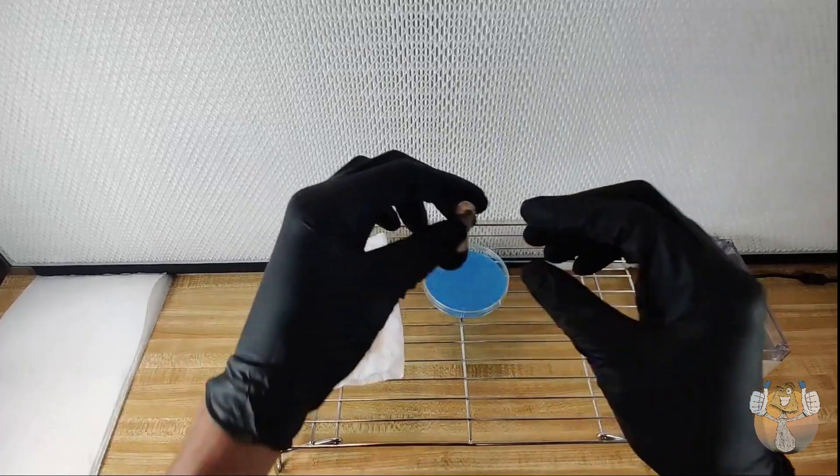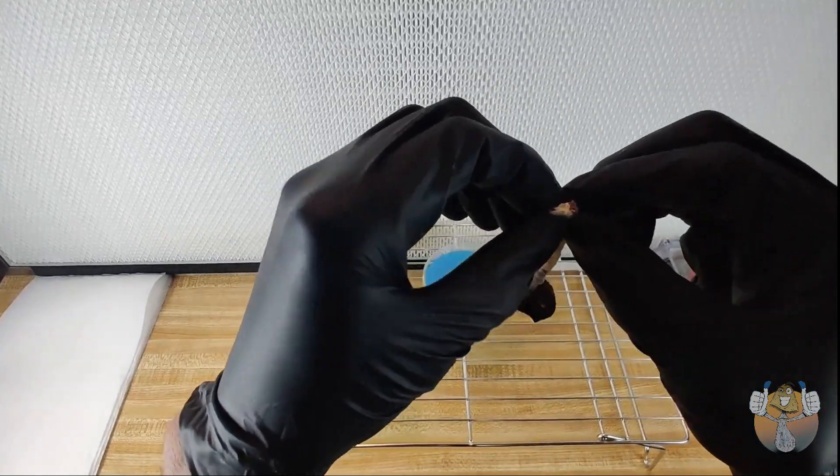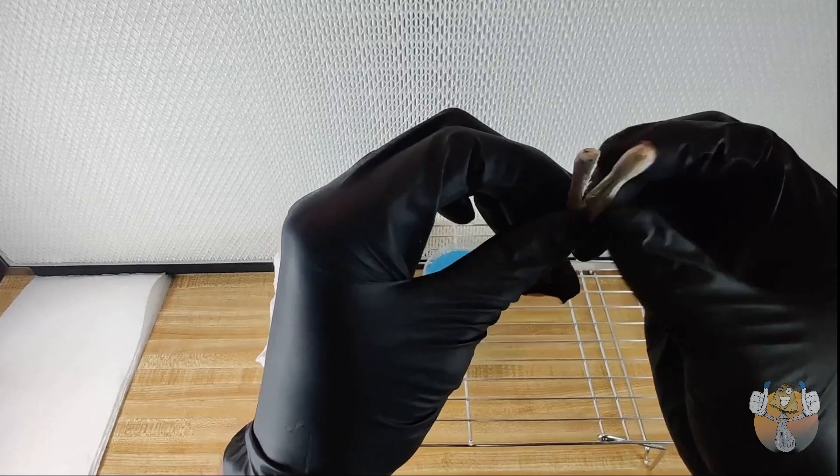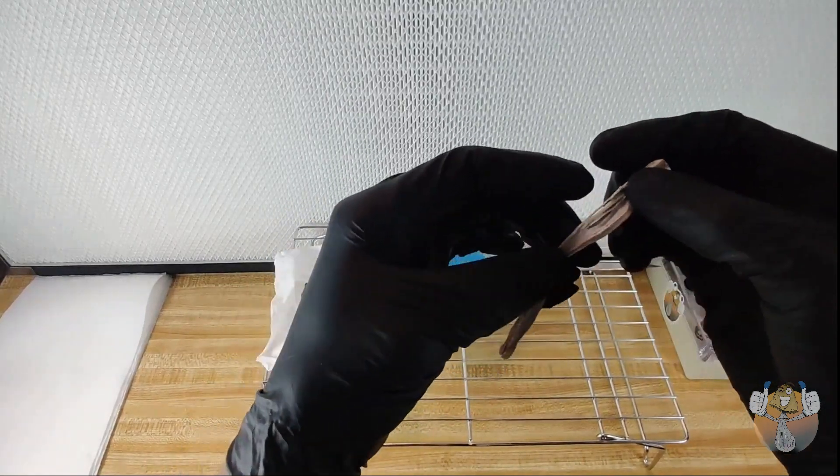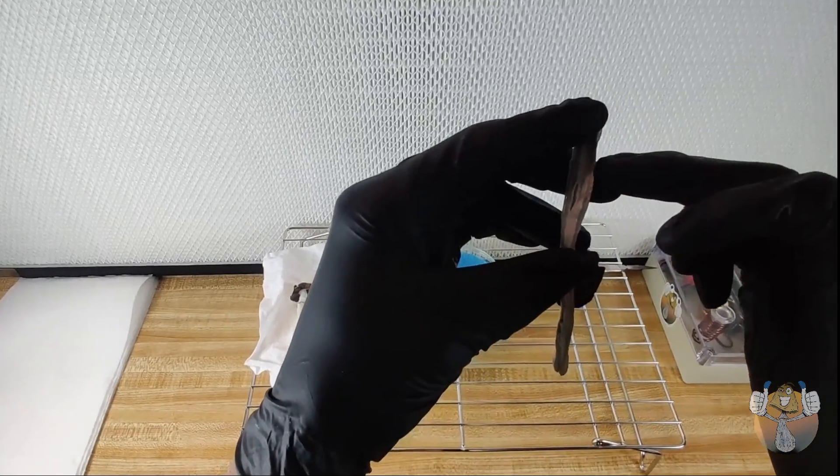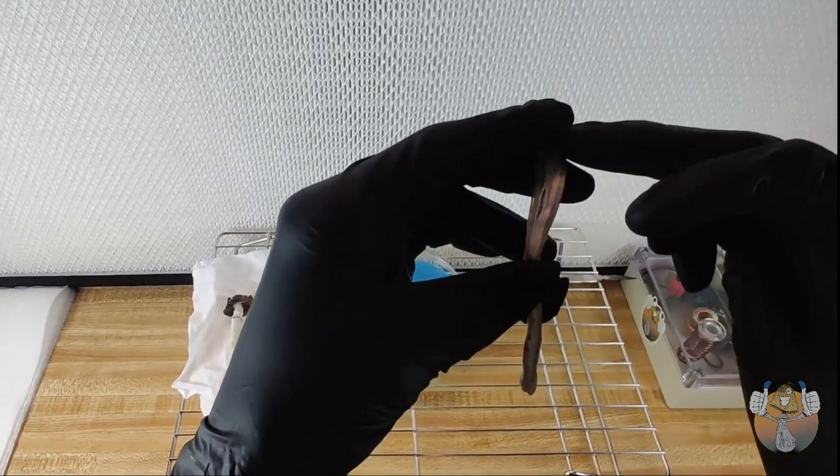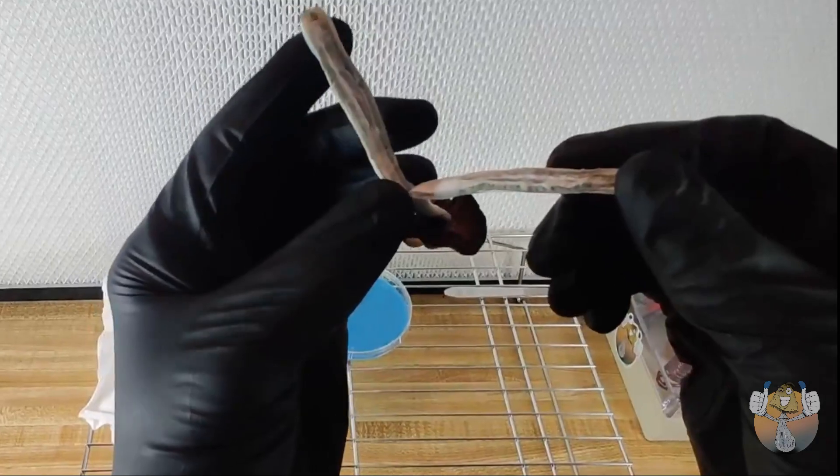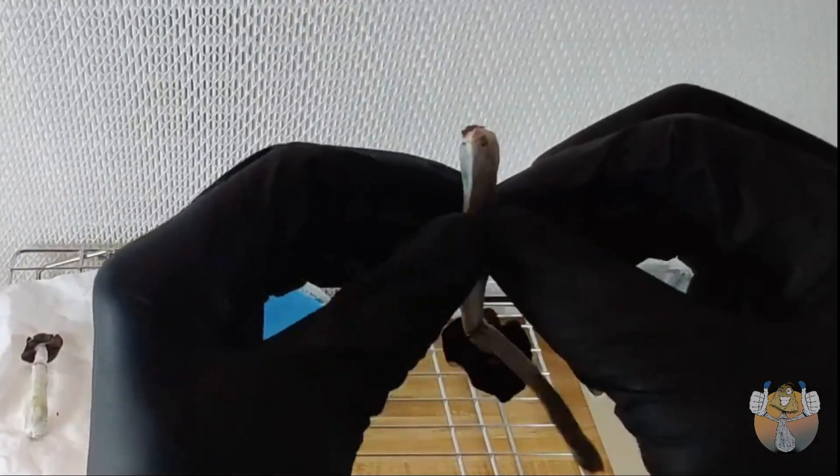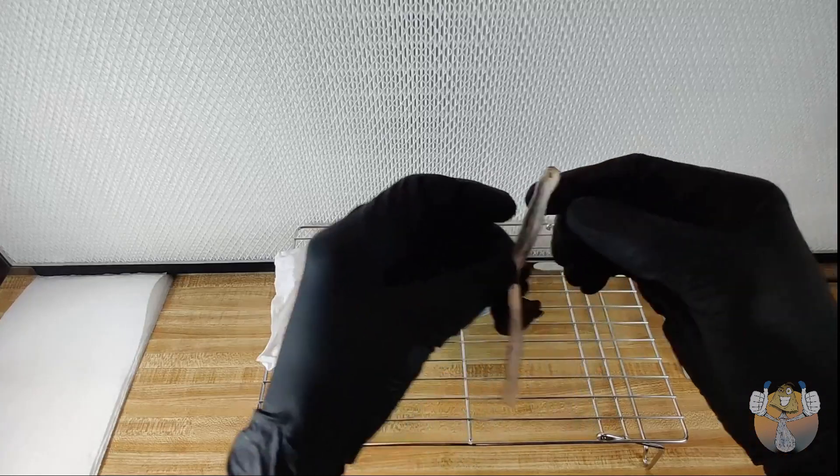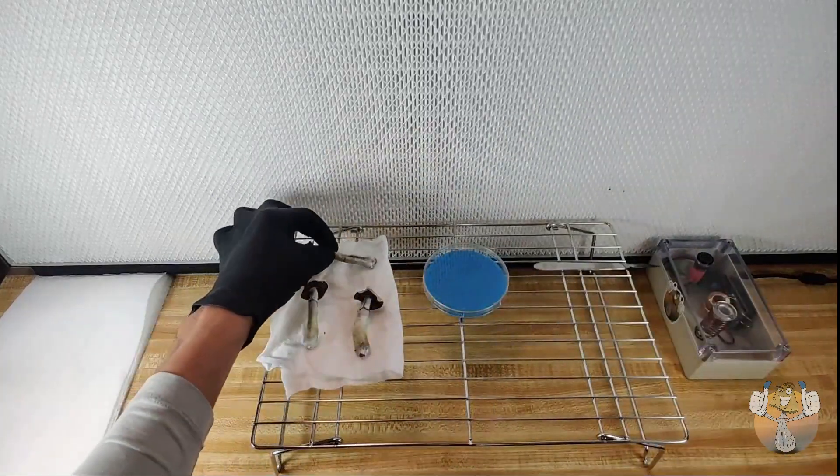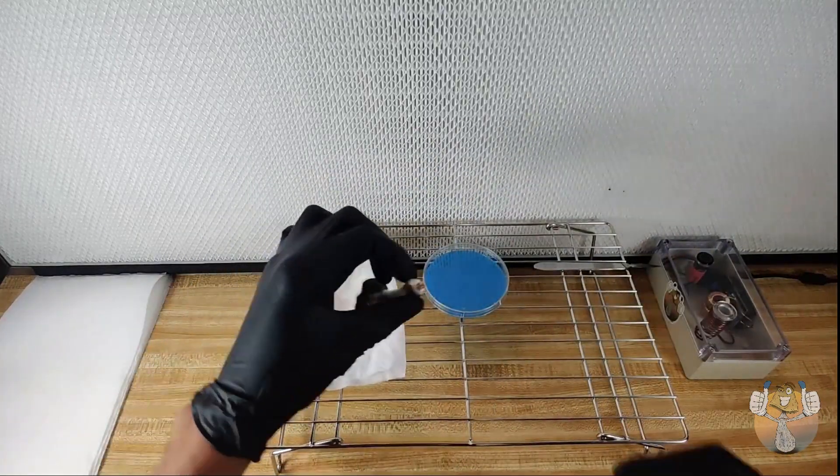I'm going to show you on this fruit right here exactly what we're going to be looking for when we make our cloning cut. See all of that whiteness in the stipe? That's what we want to clone. That is going to be our cleanest source to gather our clone material from.